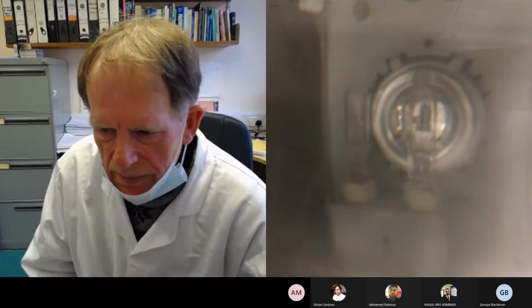Right, raise your hands, folks, when you've worked out what the concentration is. And don't forget to correct for the dilution.